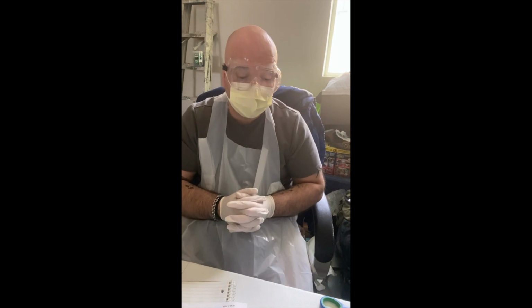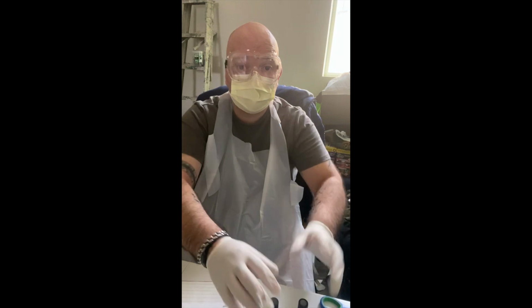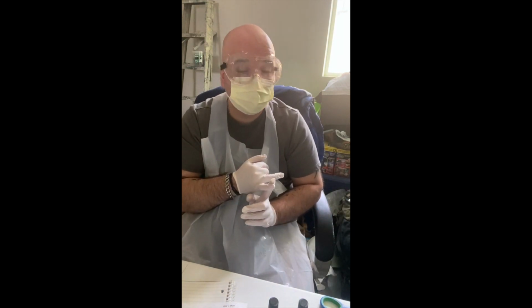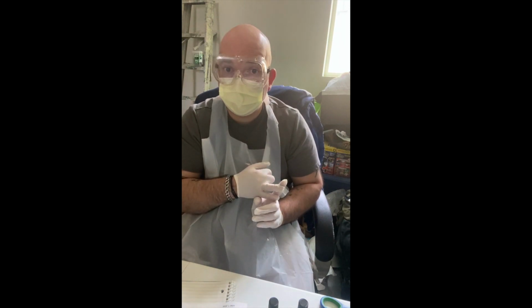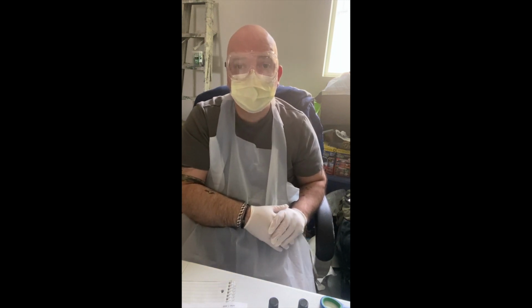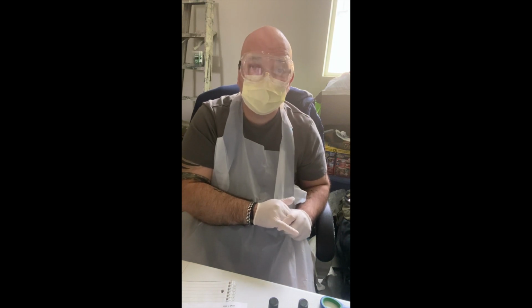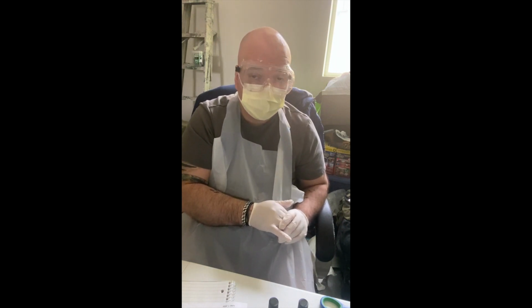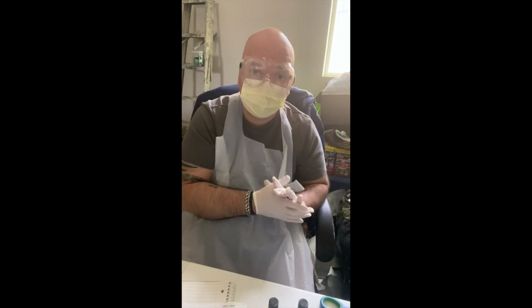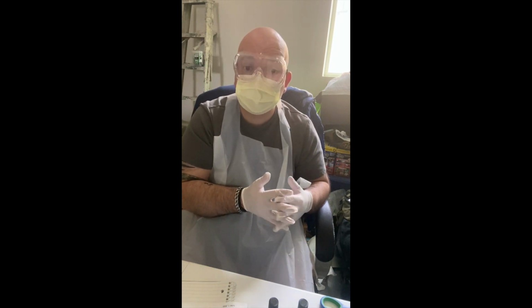So in this lab, what I did several days ago, on June 3rd, is I stabbed or inoculated, I took cultures from my petri dish of Staphylococcus epidermidis and Escherichia coli, and then using a sterilized jumbo paper clip, that paper clip then got stabbed straight down into motility agar. And this agar has been sitting in my incubation location, my dark temperature controlled closet in my home office since Wednesday, June 3rd.